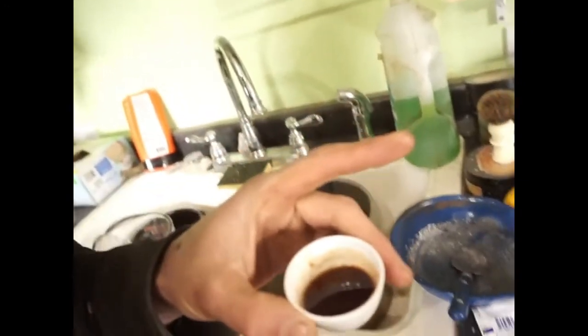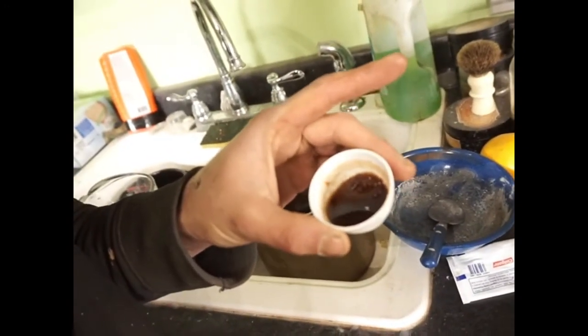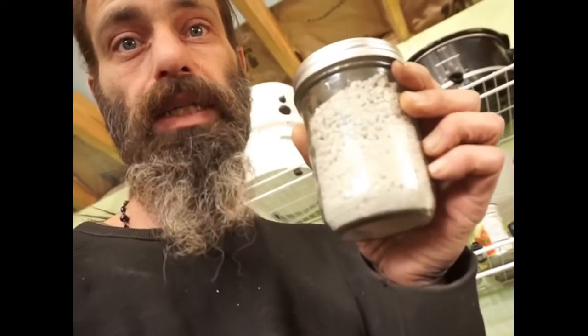When you dry it you're going to get a concentrated solution and the more you dry it off the closer it gets to this. Dry it off until the crystals form. This is the stuff from the first batch that I might use today to make soap. If you want to purify it to a higher degree — potassium carbonate should be a white crystalline solid — you can take it in crystalline form and further process it. There are little traces of green in it which I suspect are some kind of copper component rather than iron.